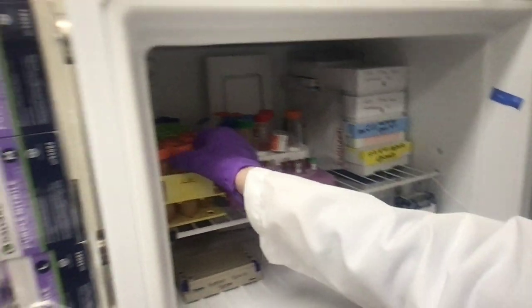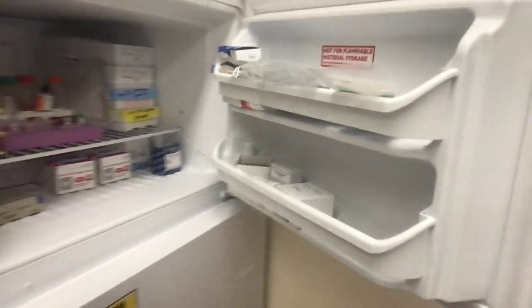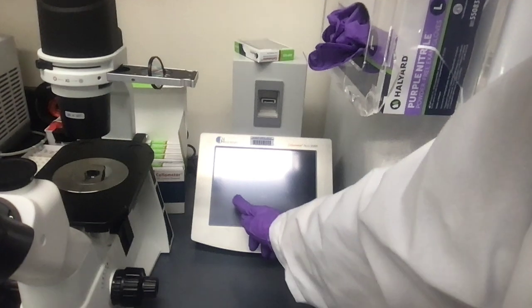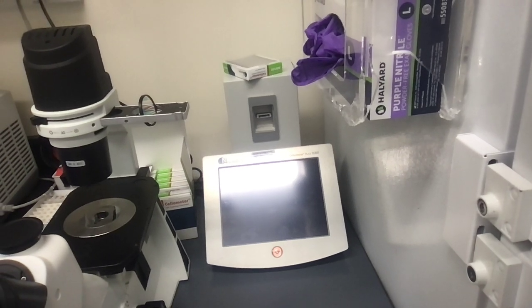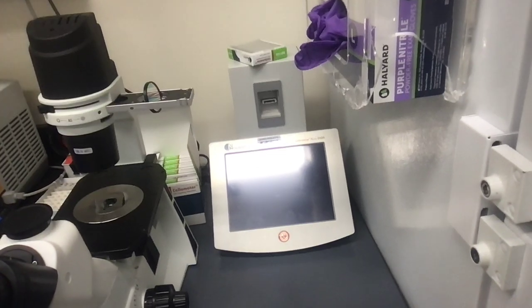We also have, in this freezer on top here, FBS, that's short for fetal bovine serum. That's also a very common cell culture medium. Basically, it provides nutrients for cells to survive and grow. Some more gloves. This device, a cellometer, is used to count the number of cells in a particular sample. So if you were to isolate immune cells, isolate those peripheral blood mononuclear cells from a blood sample, you would want to count to see how good your sample was, to see whether you got a high or a low amount of cells.